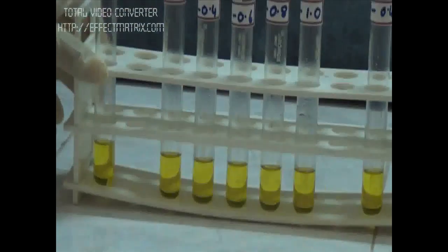Now we have to incubate it in boiling water bath for 10 minutes. As I said, we have added the orcinol in acidic conditions.